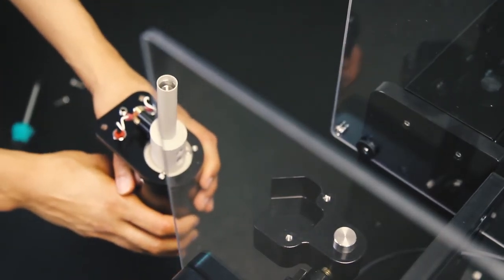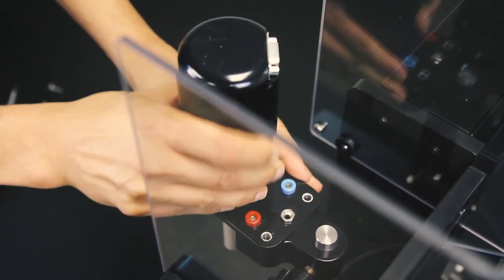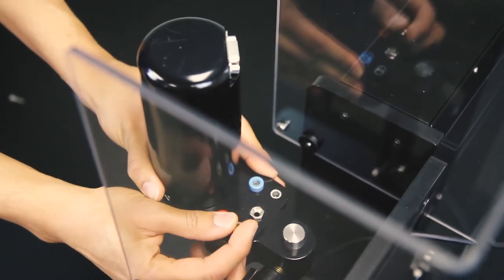Turn the motor unit right side up and place the motor unit back on the lift bracket. Install the motor unit by threading the motor bracket onto the lift bracket.